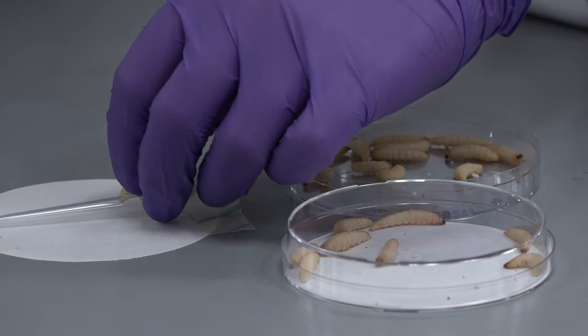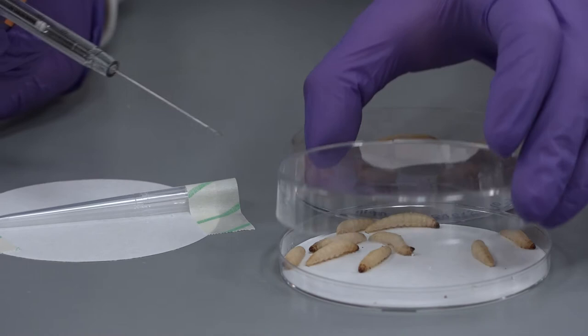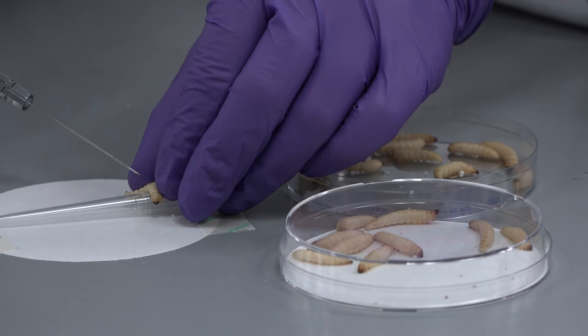For example, does an immunosuppressive drug make the larvae more susceptible to infection? When working with any drug or compound you first need to check if the drug and solvent used is toxic to the larvae or your pathogen. For more information please refer to our video on assessing acute toxicity.